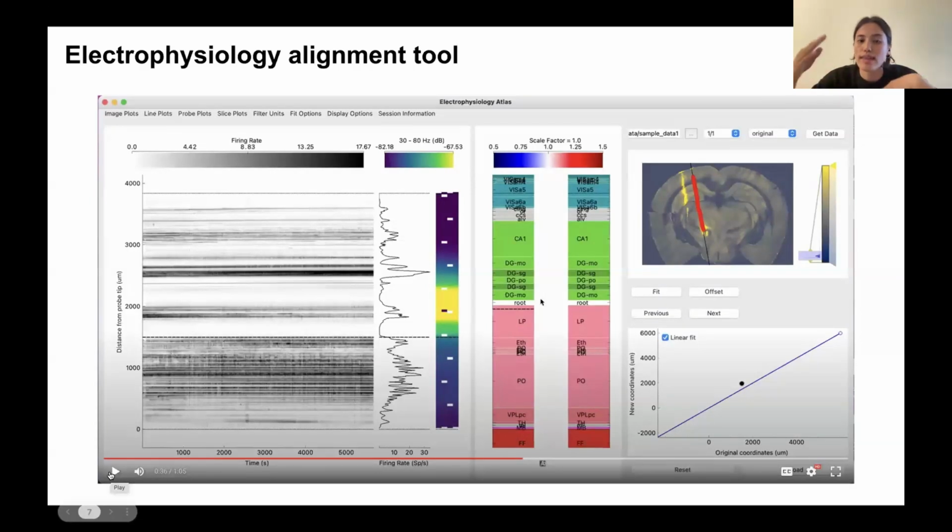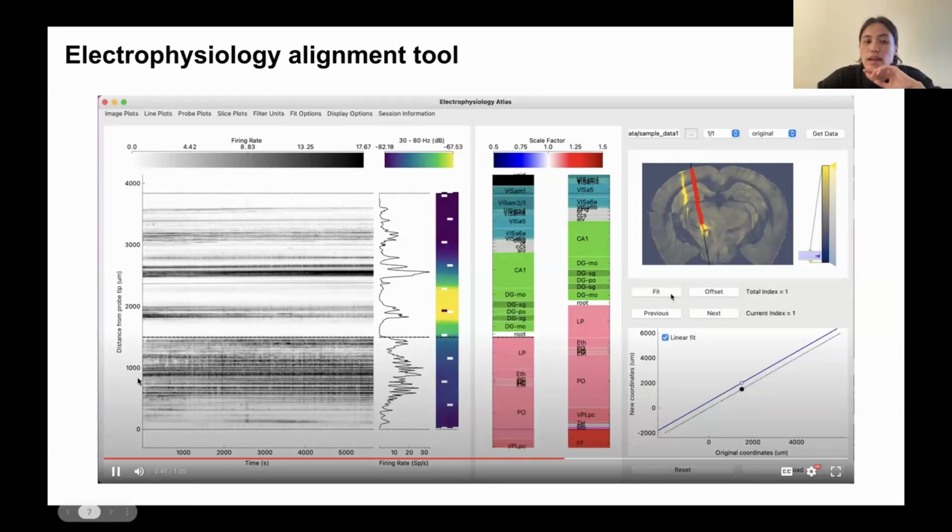And the idea is that you want to drag these lines to match the electrophysiology feature with the histology feature. So in this case, what I'm using is the boundary between the hippocampus and the thalamus, and moving my lines such that they match up where I think it's good. And then I can press this fit button and it will apply this alignment. So if you focus on the image on the right, the coronal slice, if we look before we've applied the fit and after, we can see we basically shift the location of our electrodes up in the brain.